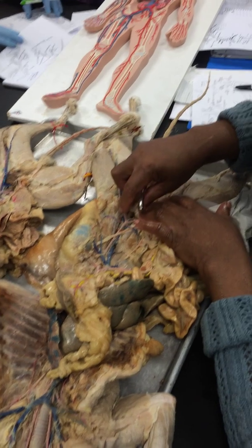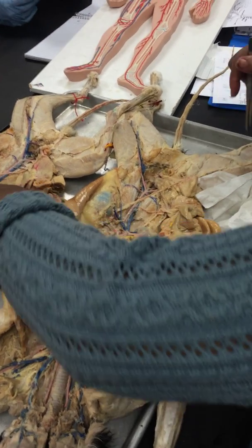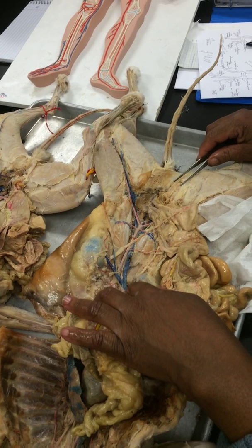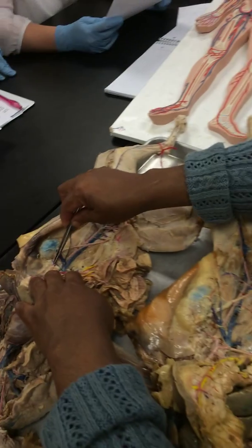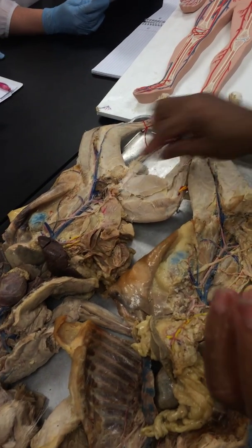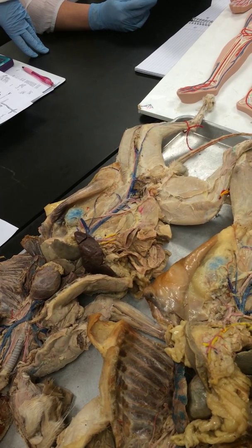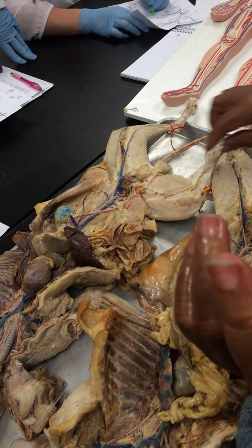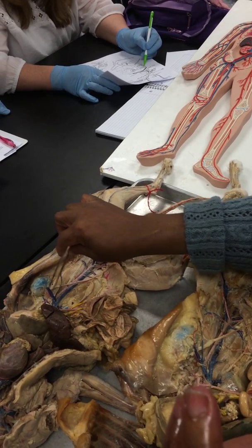Okay, so that's it for your red ones. Now for the blue ones. Again, we come through the diaphragm, and you have the long inferior vena cava coming down the center. And the first branch we're responsible for is this one here, and it's a little larger than the red one. That's the adrenal lumbar, and the adrenal gland would sit right here. So it would come and drain the adrenal gland. Lumbar branches from there would go into the lumbar vertebrae area. Then your next branch, a big one, is your right and left renal vein.